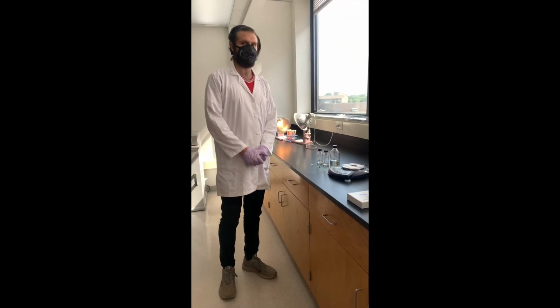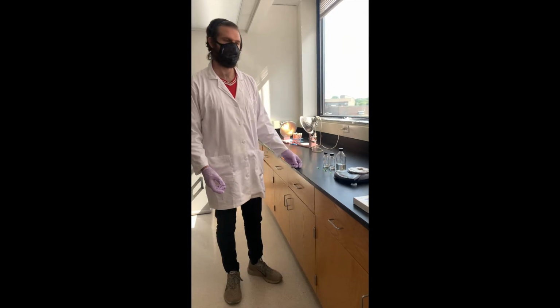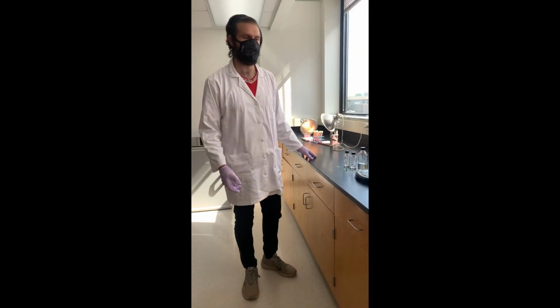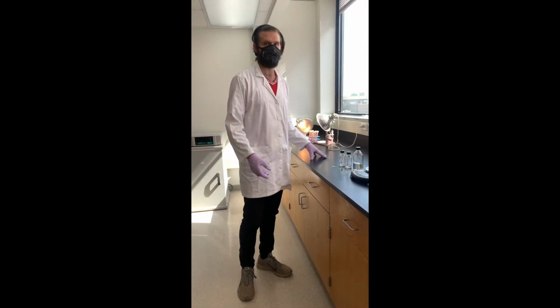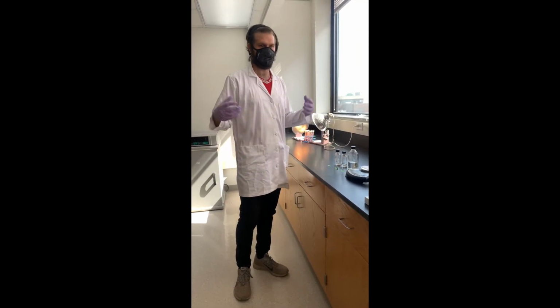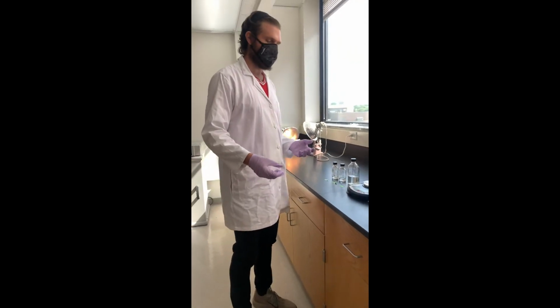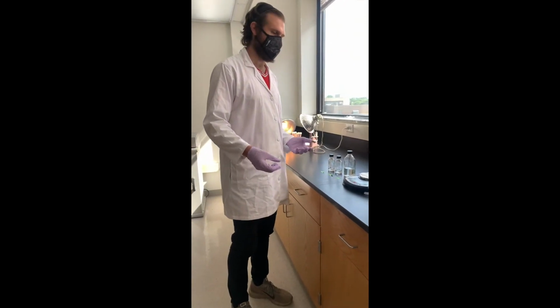So in order to isolate antibiotic producers, we're first going to start off with soil. There's incredible microbial diversity in soil. We've used it in several of our experiments already. And part of that microbial diversity includes a lot of bacteria that can actually make antibiotics. So to start off, we need to make a dilution series.